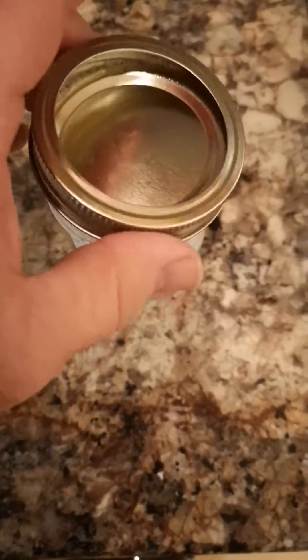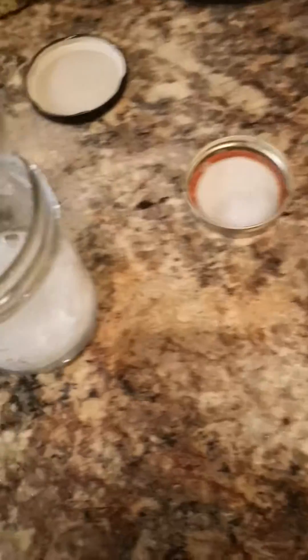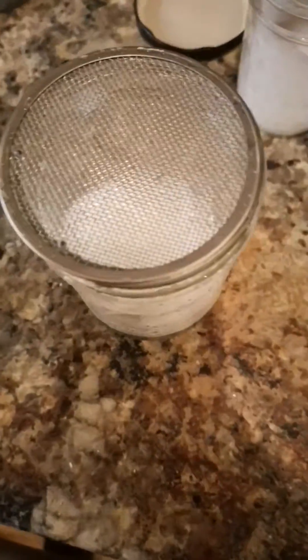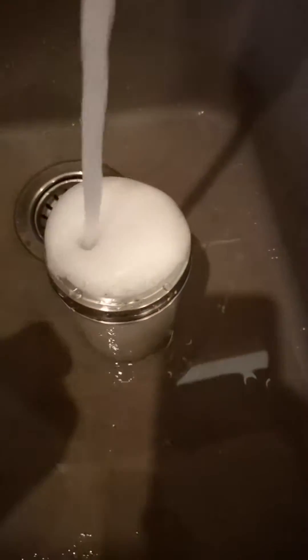There are workarounds to some of these things. So I'm doing this by hand with a mason jar, but with the help of a sprout kit made for mason jars, I can somewhat automate this. Make sure it's not too hot, not too cold — I like a little bit warm, and you can leave this in here for a while.